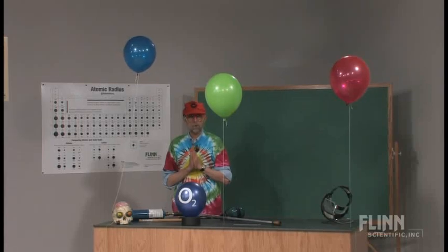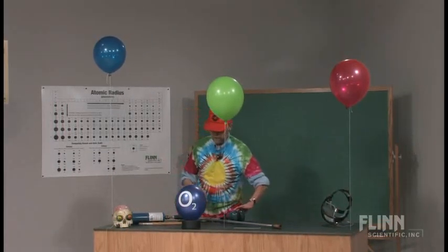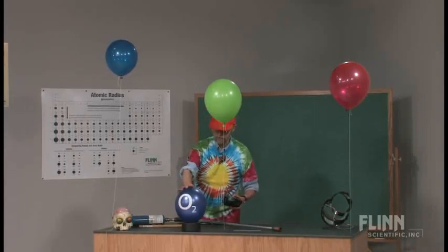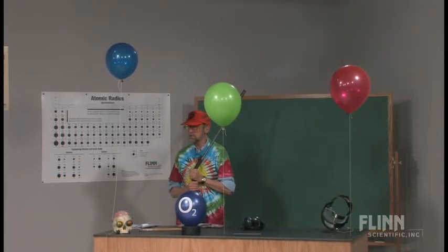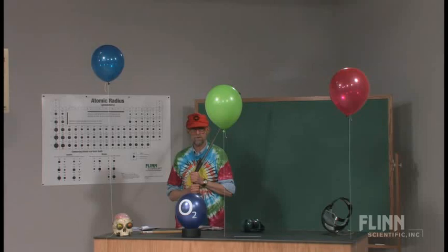We're going to ignite these one at a time and look at the different flame fronts produced and see if you can figure out what's in what. Obviously this one's the oxygen. One time of year to do this is around May 6th. Something interesting happened on May 6th.